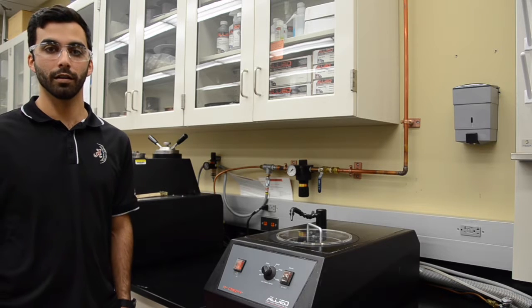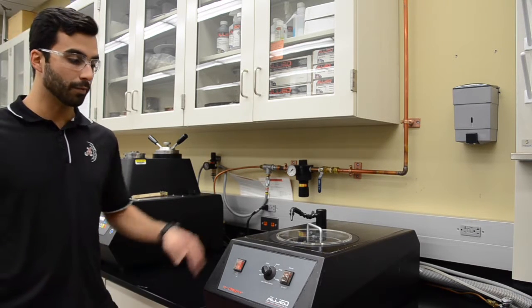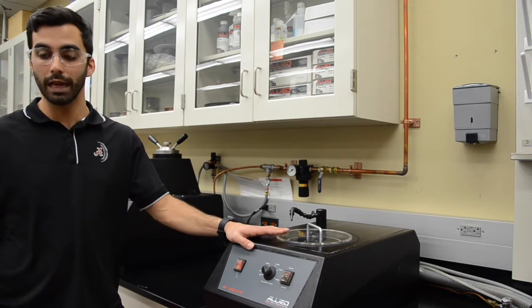Hello everyone, my name is Oscar Rivera and in collaboration with Omar Rodriguez, which is behind the camera right now, we're going to be explaining how to grind, polish, and etch.